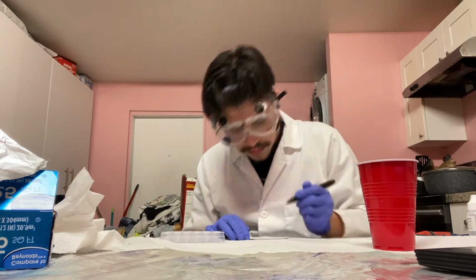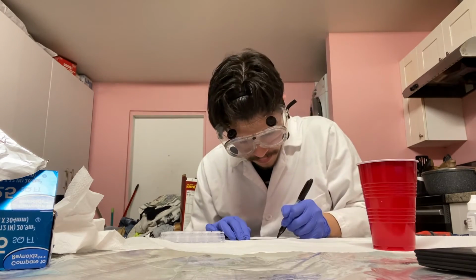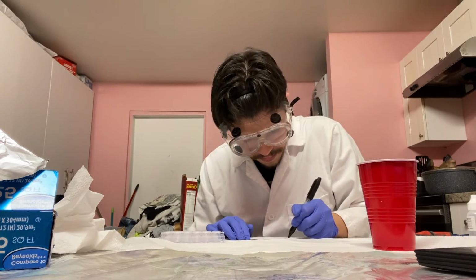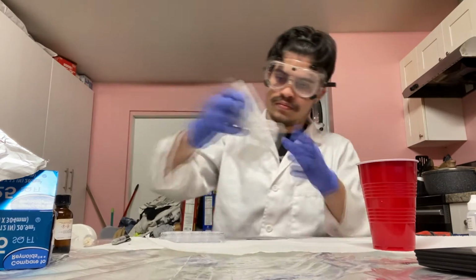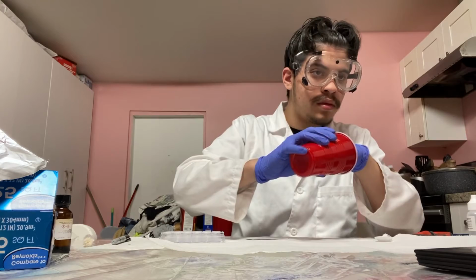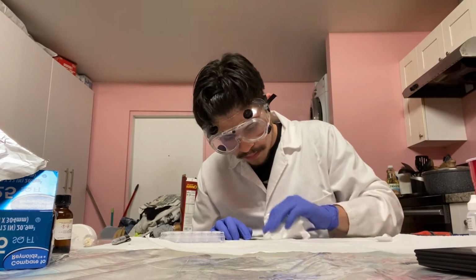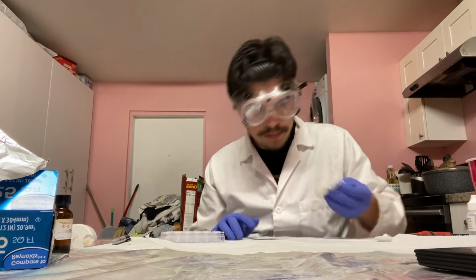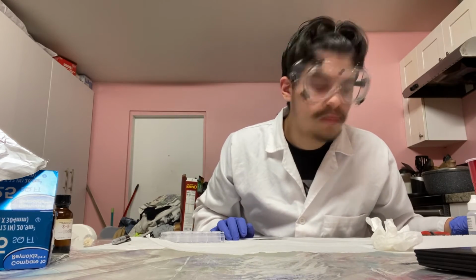Upon contact with the aluminum foil, make immediate observations and record them. It is also important to record the time that the chemical reaction started. Once you recorded your initial observations, let the AgNO3 sit on the aluminum foil for 5 minutes. Once 5 minutes are up, record your observations once again. Observations will be recorded for both the compound, aka the chemical reaction, and the aluminum foil.